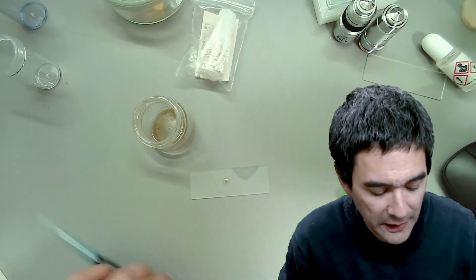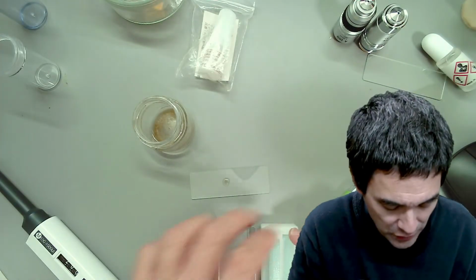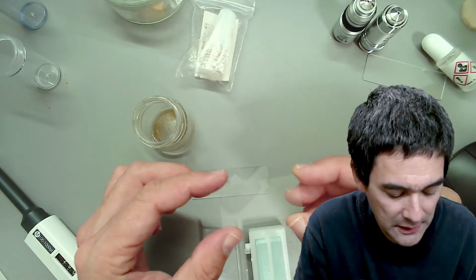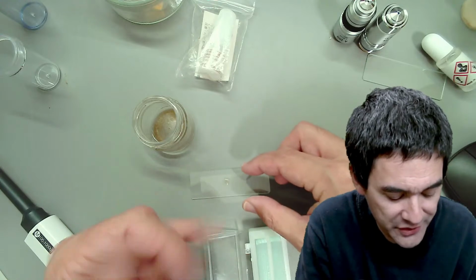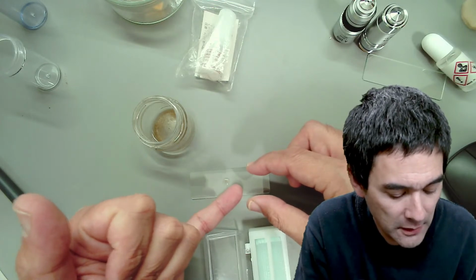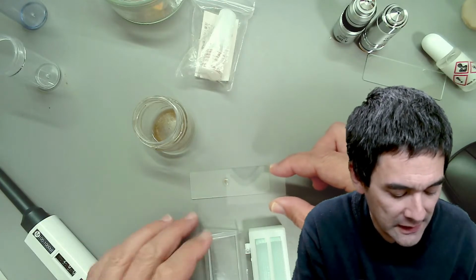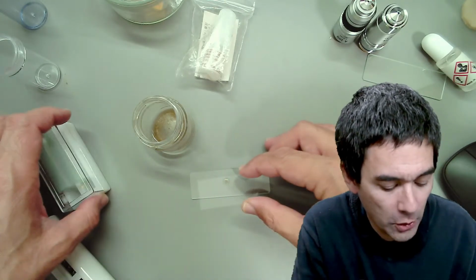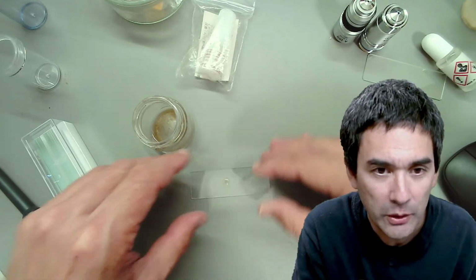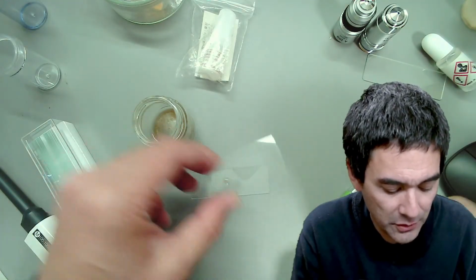Of course I can use a regular sized cover glass, but I'm just going to use a big one right now. I got myself those huge ones, and the reason why I'm using those is because then I have a large area where I can do the oil immersion microscopy, and there is not so much danger of going off the edge of the cover glass when I move it, because of the large surface area. The cover glass also sticks quite well to the slide. But I see again there are some fingerprints on here.